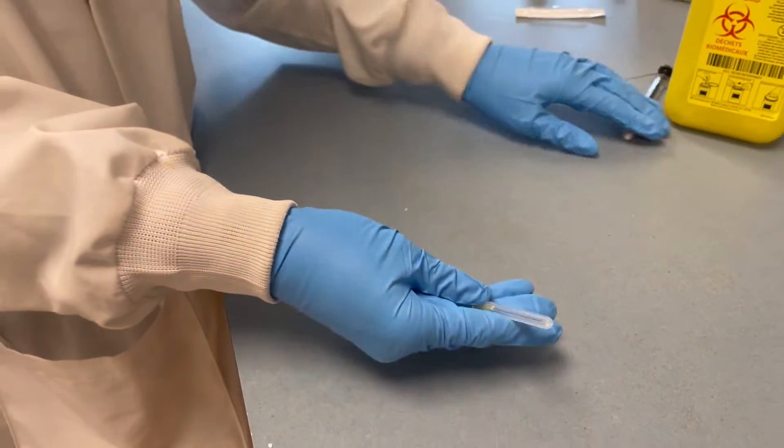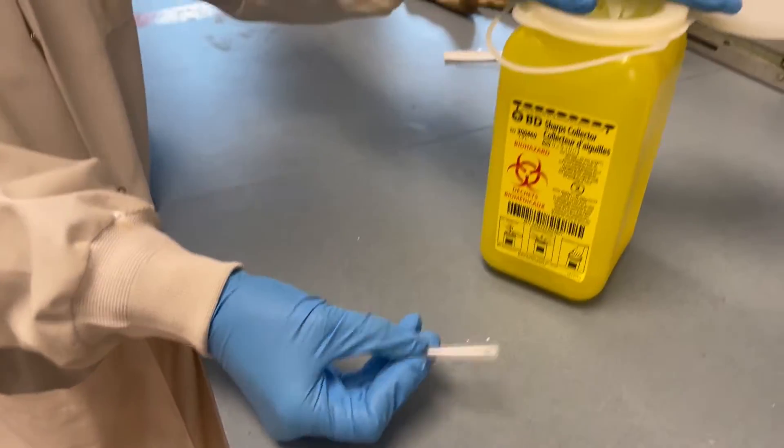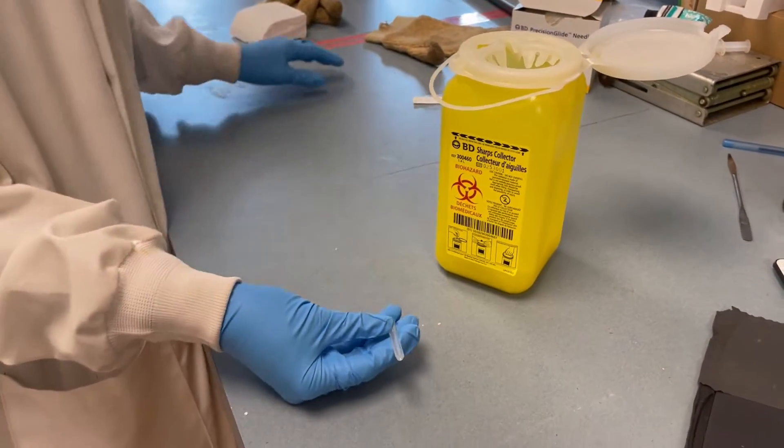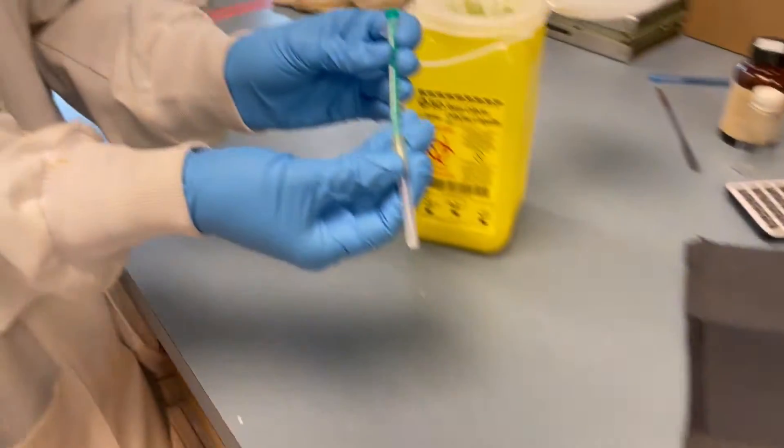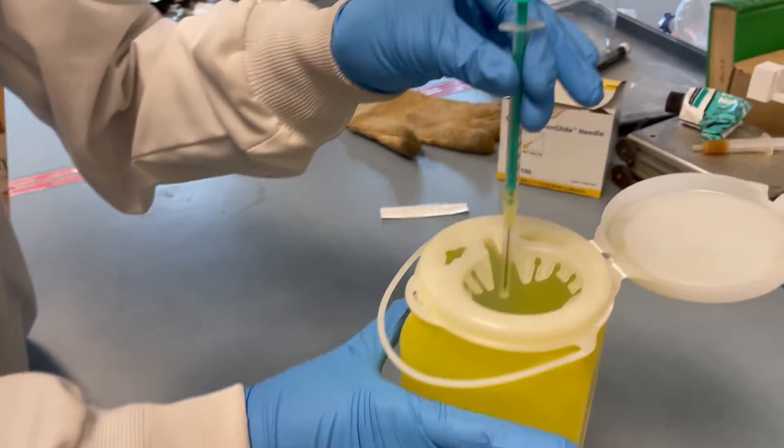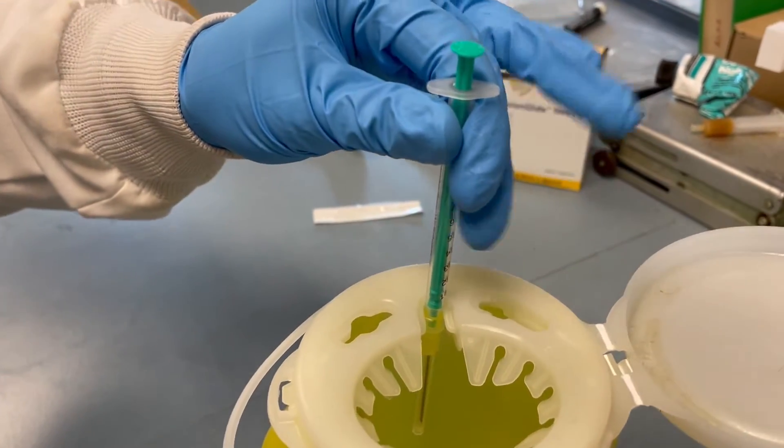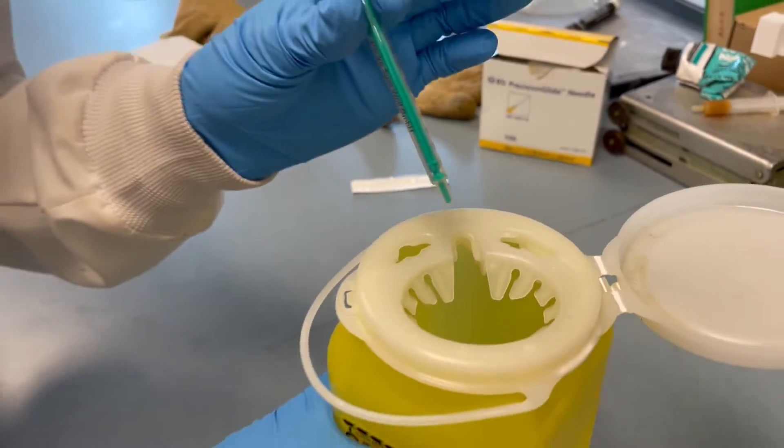To dispose of these you can just toss them in a sharps container, but if they are on one of these it has a little thing in here where you could stick the needle in, push up, and it comes off on its own.